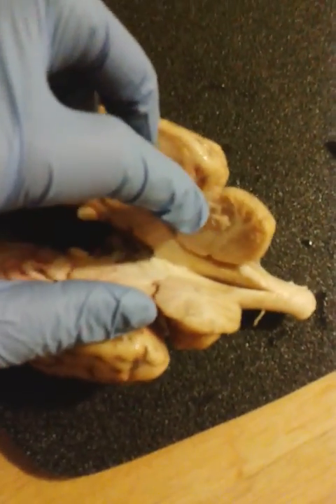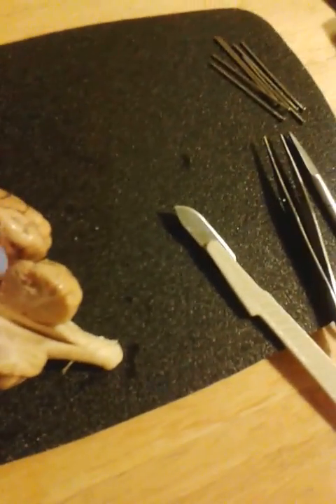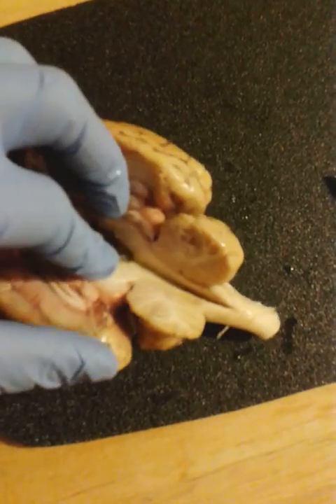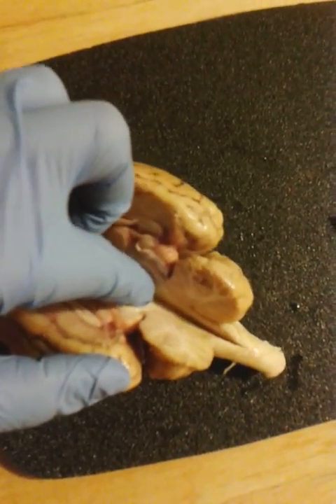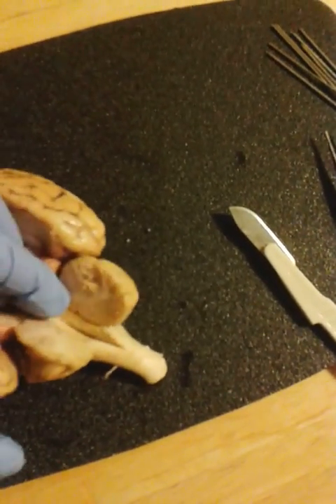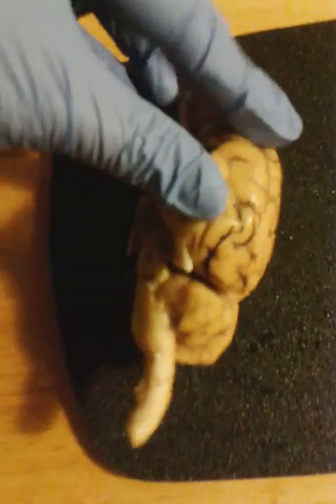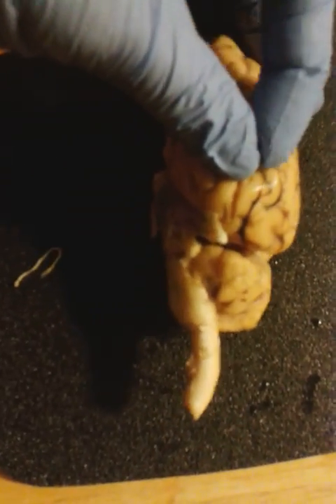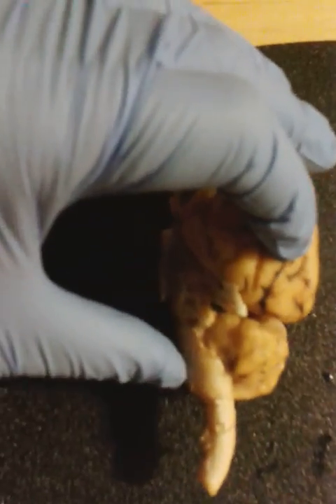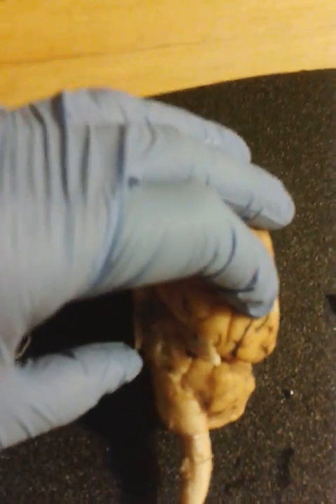Here's the cerebellum. And the pons is right here. And the medulla oblongata is right in here. From the posterior, or from the exterior, looking at it from the side, we can best appreciate the medulla oblongata right here because it's the widest portion of curvature, and then the pons would be within this structure right above it.